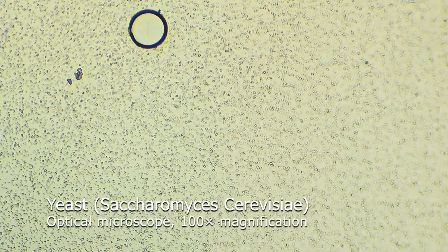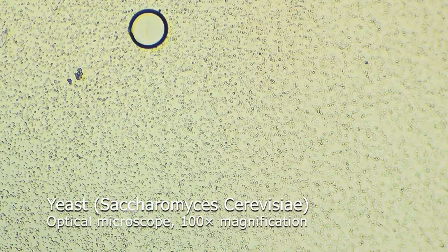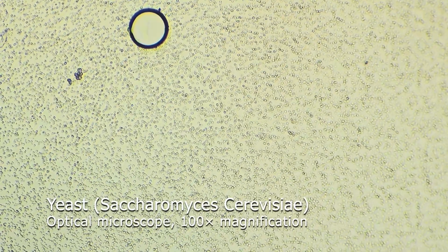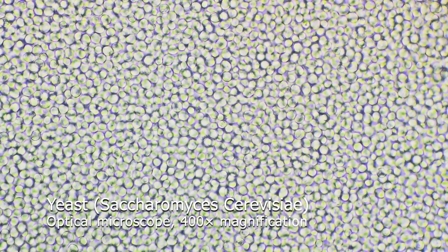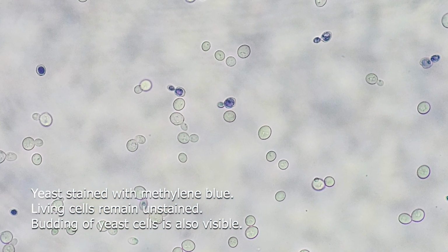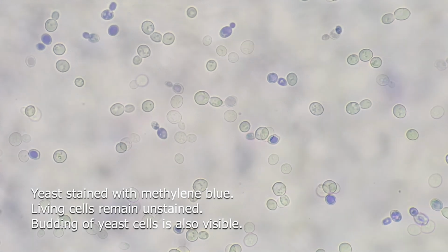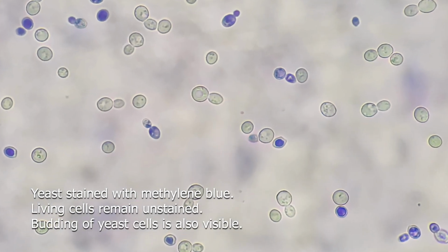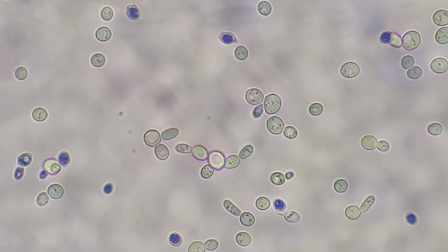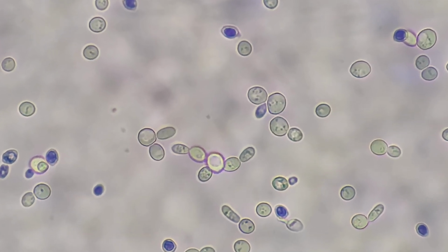We usually associate yeast with baking bread or making wine, but in reality, they can be found almost everywhere in nature. They live on the skins of fruits, on plant leaves, in soil, and even in the air. That's why fermentation can happen completely naturally, even without adding baker's yeast. Yeast is also a valuable source of vitamins and protein, which is why it is used not only in food, but also in cosmetics, for example, in products for hair and skincare.